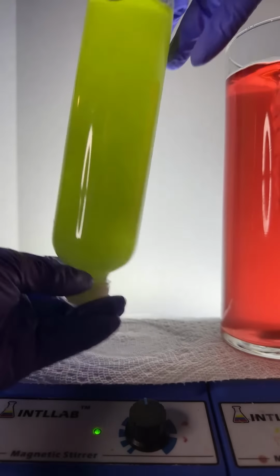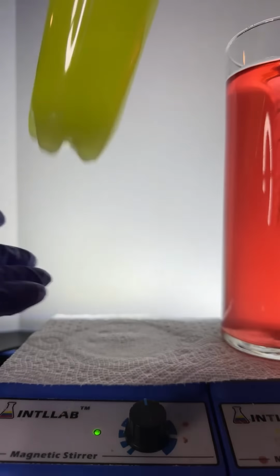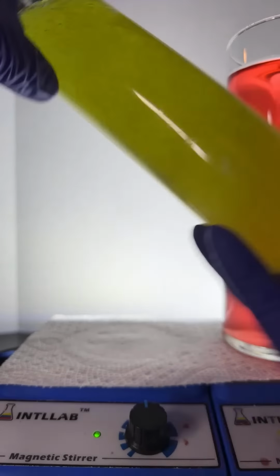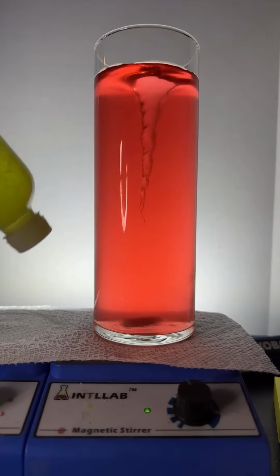It's going to take some time for the salt to dissolve, but when it does, you're going to love the result. Let me give this a good shake. Shake, shake, shake. And while we're waiting, because this does take some time, I'm going to move over here so we can take a look at our pH bottle.